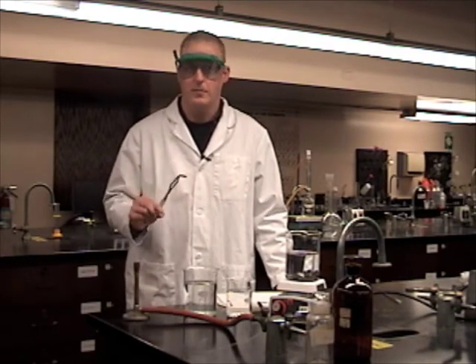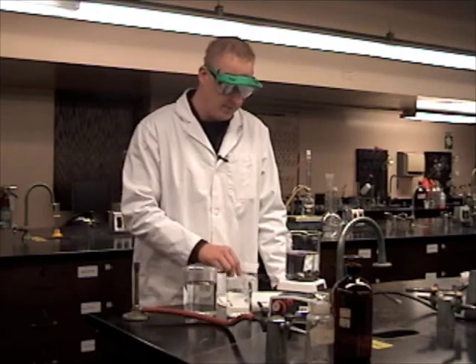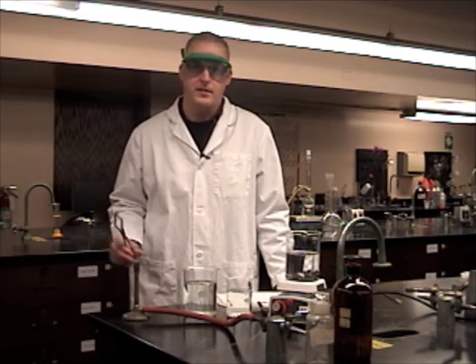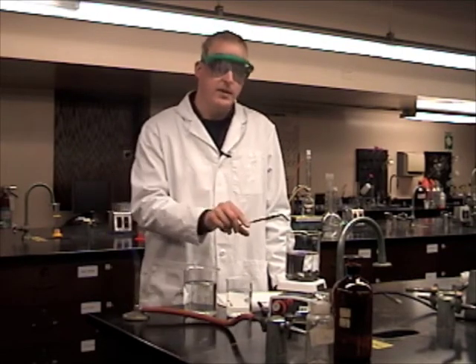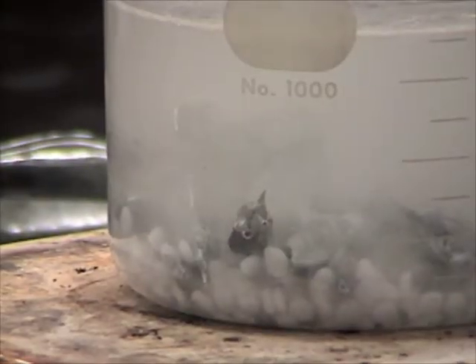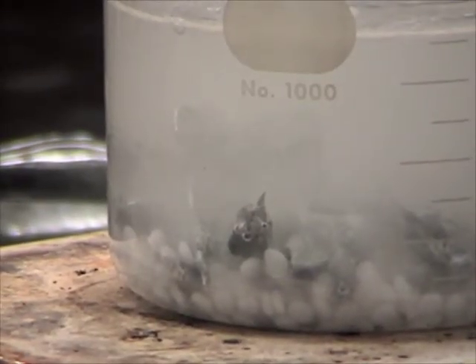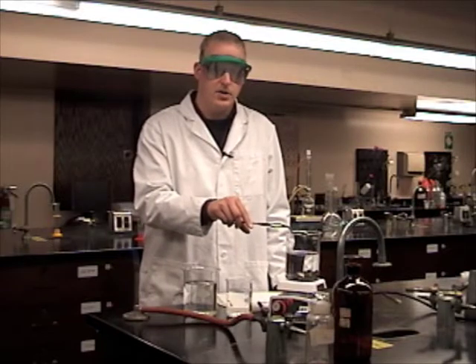We're not really going to turn it into gold, but we'll talk about the science in a little while. It's a very simple process. What we do is we take a little bit of zinc and some sodium hydroxide and we add just regular pennies right into that mixture.